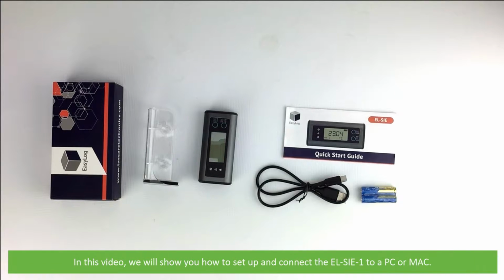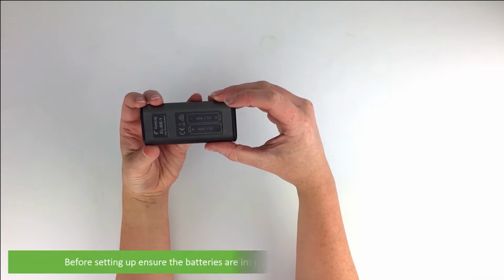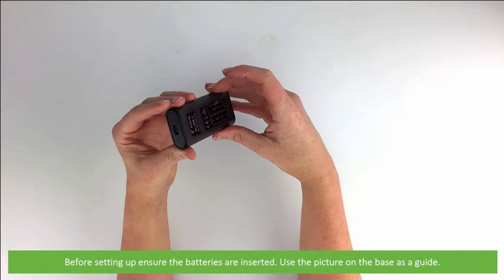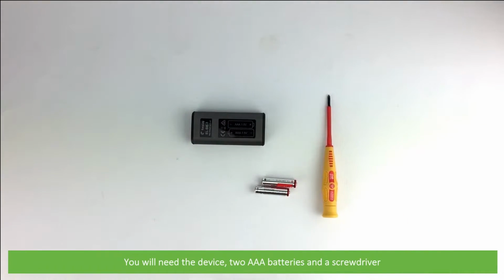In this video we'll show you how to set up and connect the EL-SIE-1 to a PC or Mac. Before setting up, ensure the batteries are inserted. Use the picture on the base as a guide. To do so, you'll need the device, two AAA batteries and a screwdriver.